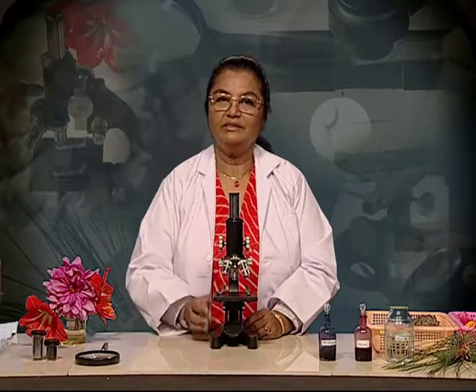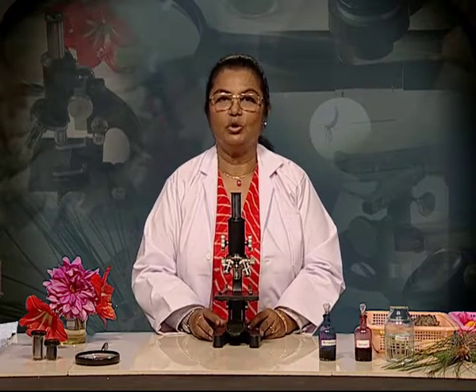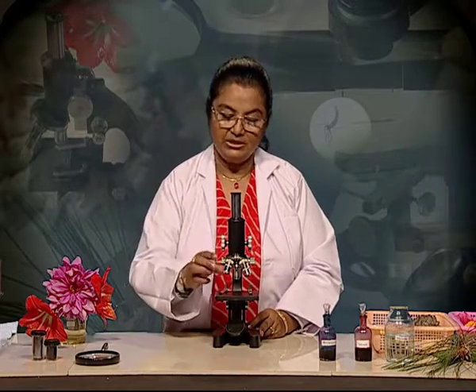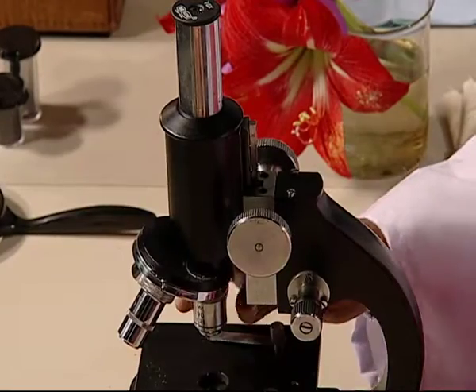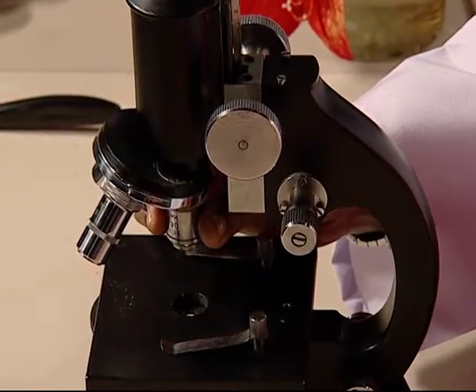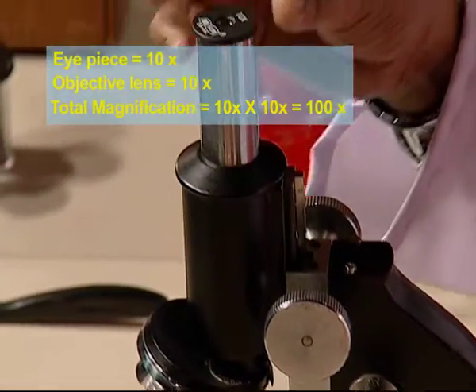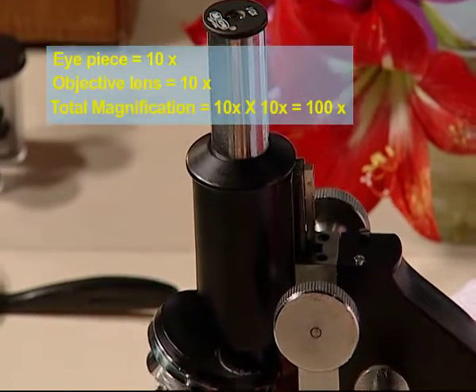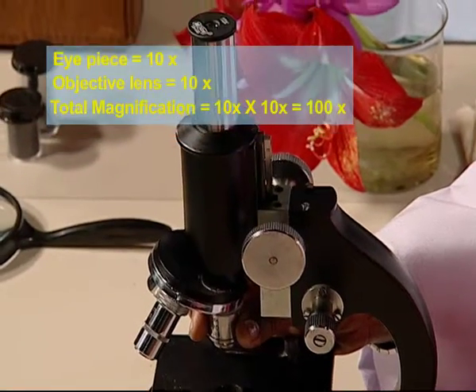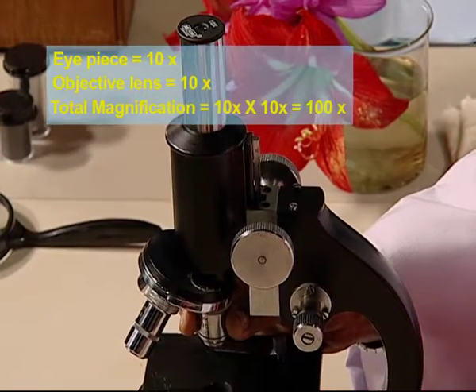Let us combine the magnifications and see how big the size of the image would be. If we look at an object with the low power objective, which has a magnification 10x, then the 10x of the eyepiece multiplied by the 10x of the objective will give us a magnification of 10 into 10, that is 100 times the size of the object.